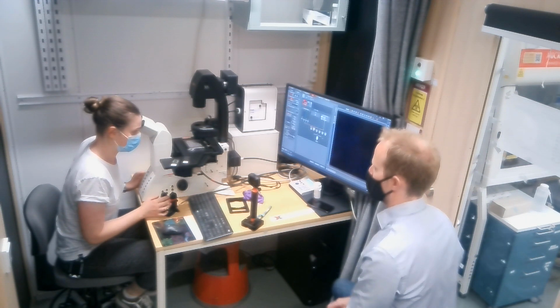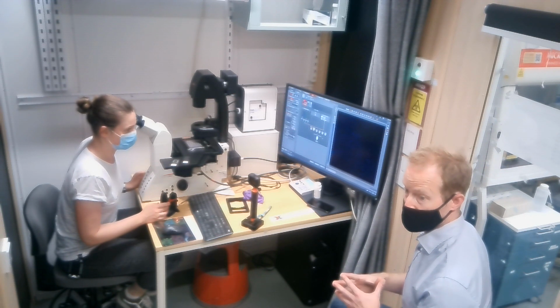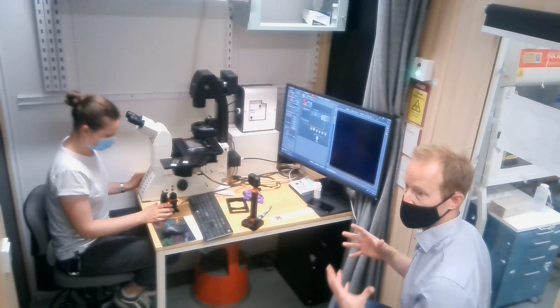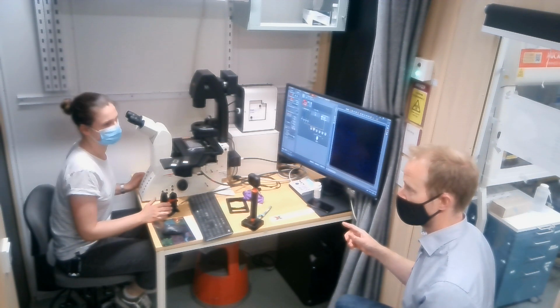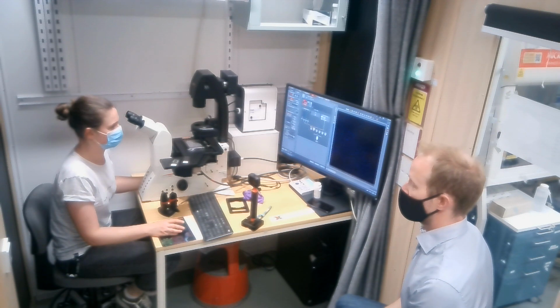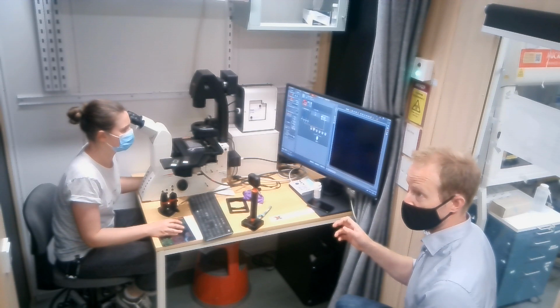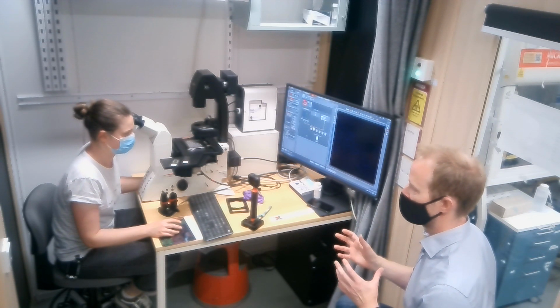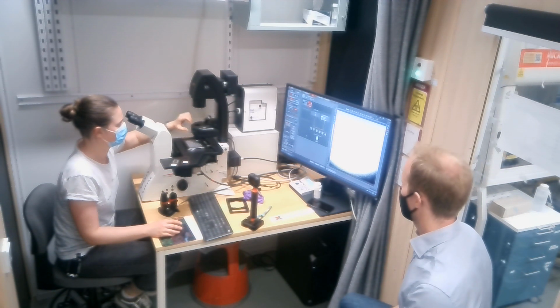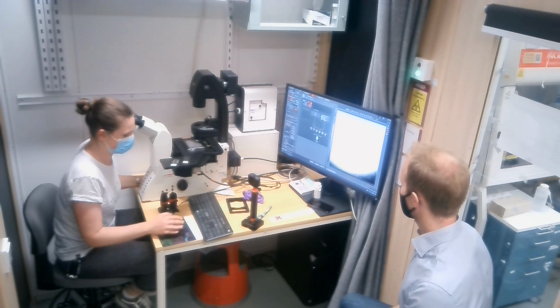So with the 5x objective, these fine and coarse are related also to the magnification. With the 5x, I wouldn't expect a very big difference between fine and coarse, because you're at such a low magnification, so if you just do it slowly, it will be fine for the 5x. Whereas with the 63x or the 40x, fine needs to be really fine, because otherwise it goes too fast. So with the 40x you will have a bigger difference between fast and precise compared to the 5x. And can I put a scale bar on that image?